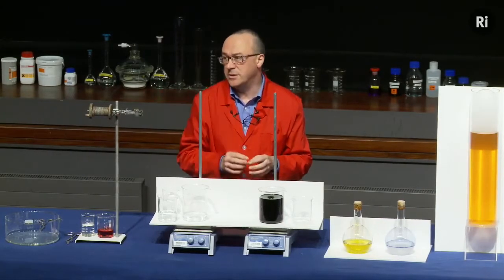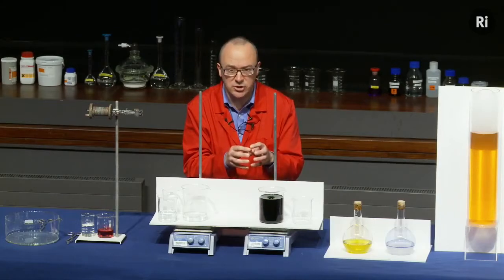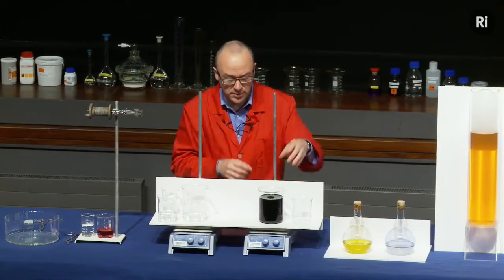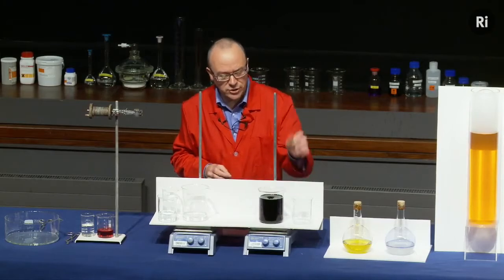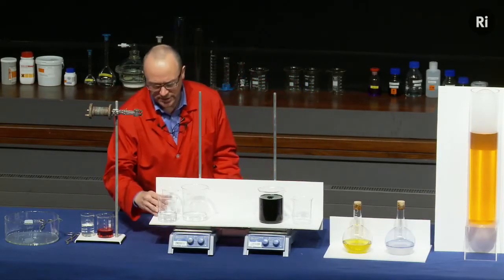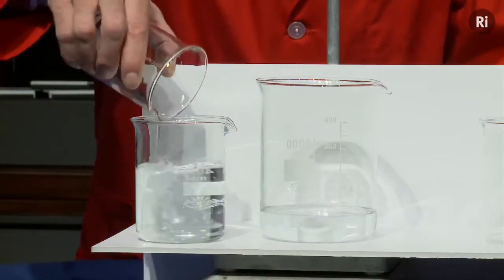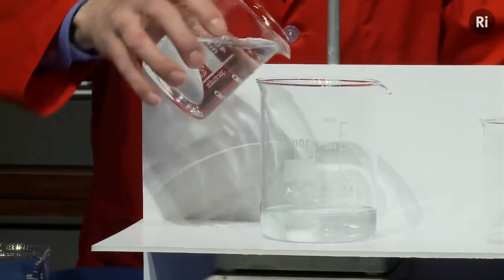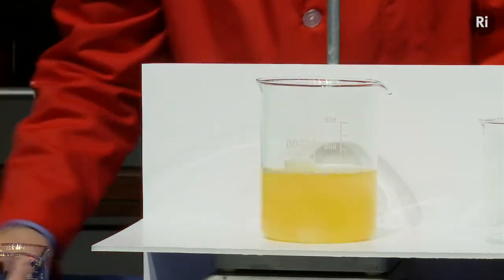So the iodine is being produced slowly, it's being mopped up by this second material as soon as it's produced, but when that second material runs out after about 10 seconds or so, the next little piece of iodine to be produced remains in solution. And because the iodine's a bit hard to see from the back of the room, we've added some starch. The iodine reacts with the starch and produces a very dark blue colour that appears to be almost black. Okay, so that's called a clock reaction. So now that you understand how that one works, have a look at this one. So this involves three colourless solutions. So I pour that one into there, and I pour this into here. Again, watch closely.